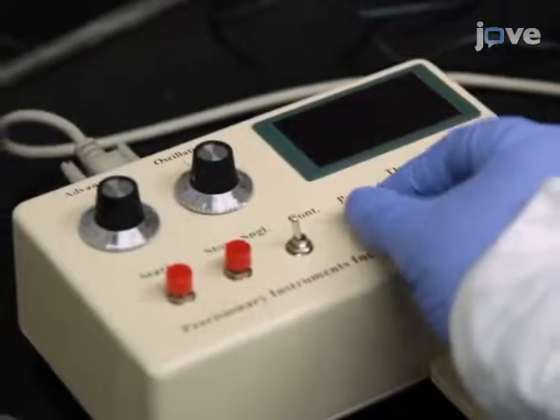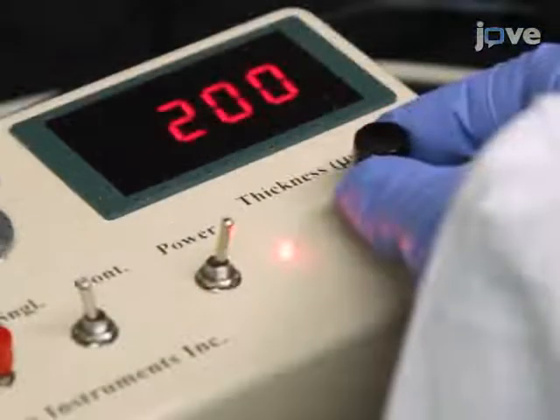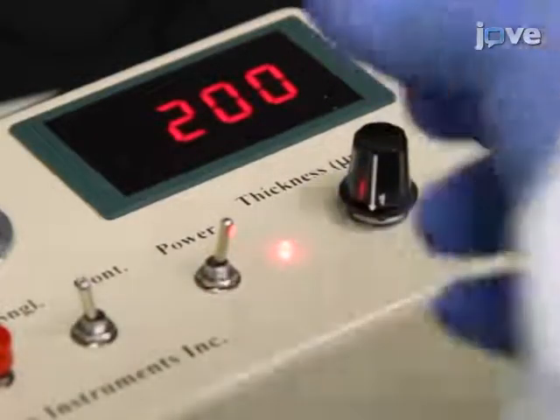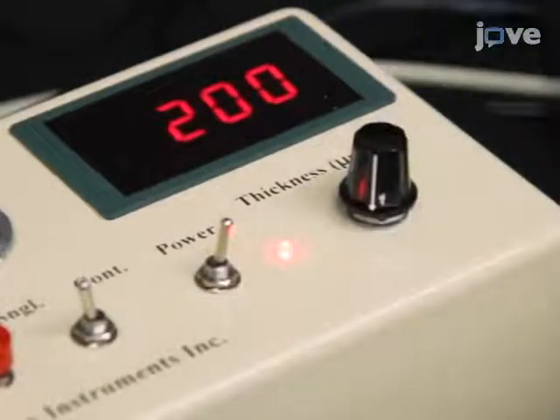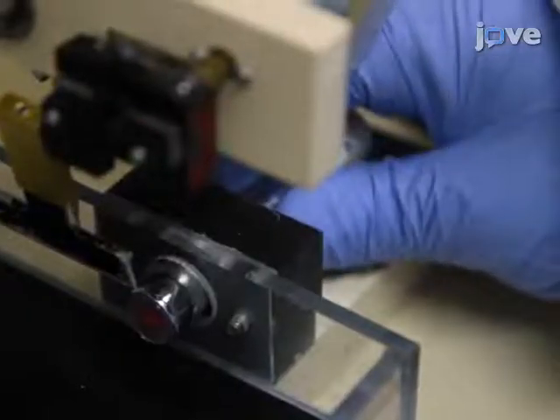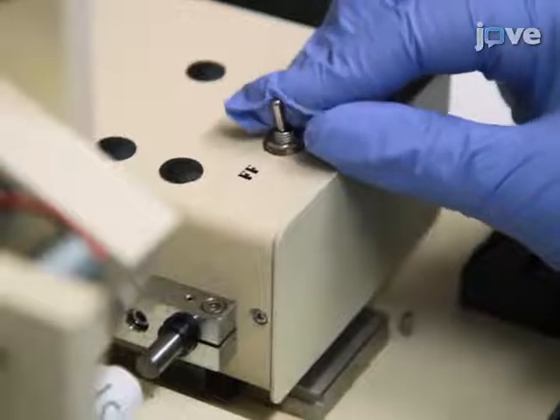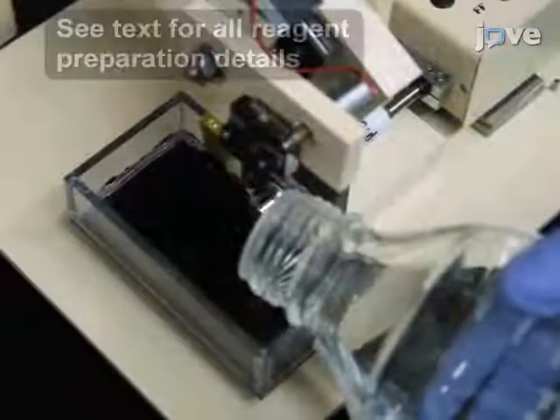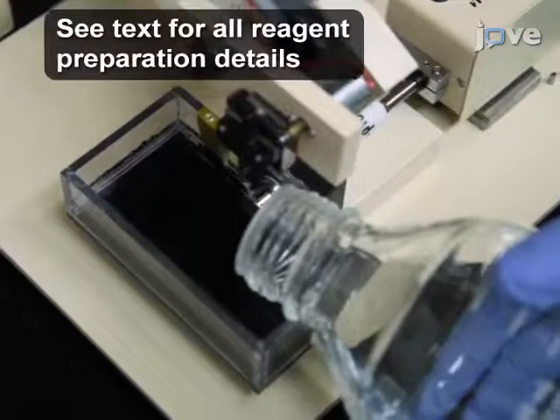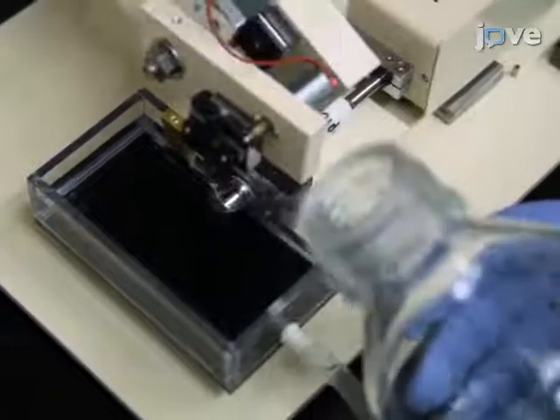When the agar has solidified, turn on the microtome and set the thickness setting to 200 micrometers. After installing a new razor blade, insert the plungers into the microtome bath. Fill the microtome bath with 100 to 200 milliliters of freshly prepared PBSH and add PBSH ice cubes to maintain temperature.